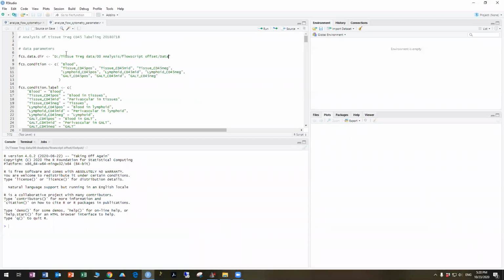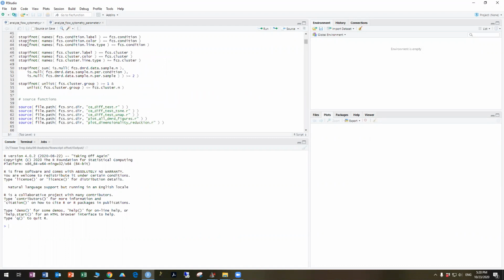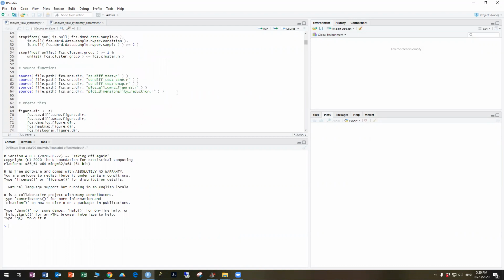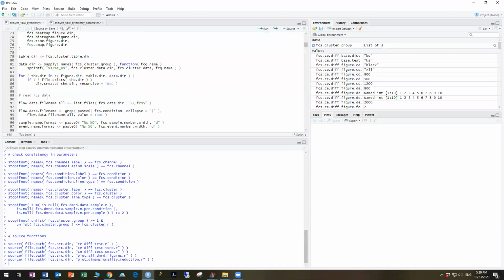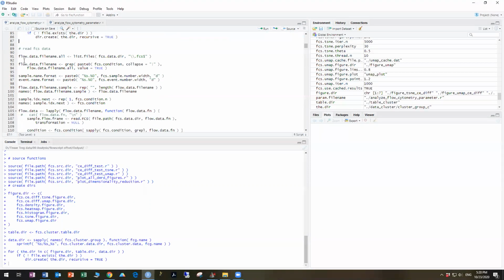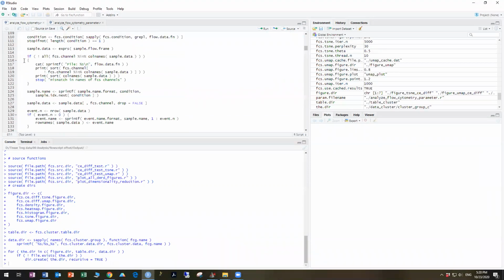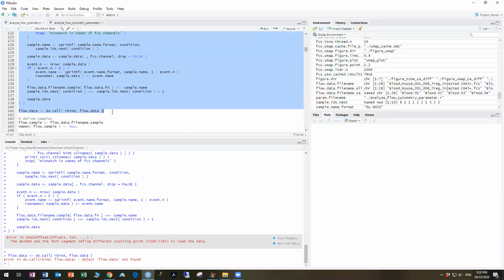So I'm going to open this new parameter file, and we're going to run the script based off of this parameter file, which I've already set up. So we're going to just run a bunch of the segments here. The error doesn't crop up until later when you're trying to load in the FCS files. So we run all that, and then it's this part that says read FCS files that is really going to produce the error, because you're going to get this, which is its error in check offset.